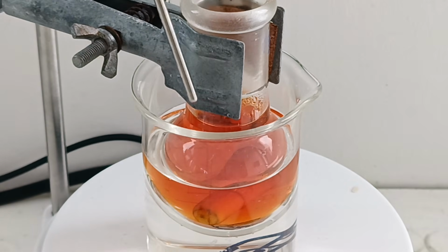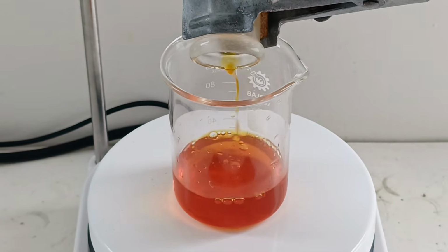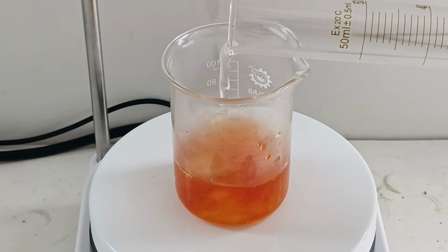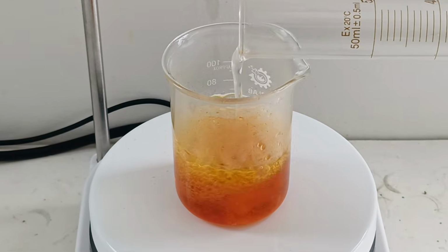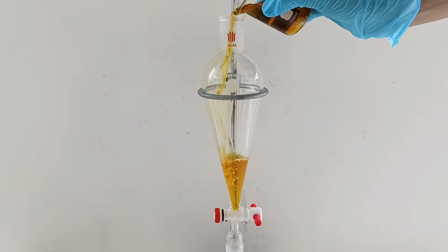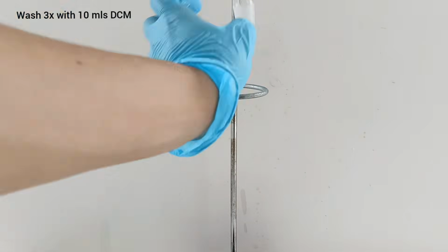Once no more nitrogen gas is observed being released, which took around 15 minutes, I decant the solution into a beaker. We now need to extract the resorcinol from the mixture. The first thing I do is add some dilute sodium bicarbonate solution to neutralize the remaining hydrochloric acid and form its salt. This also causes any unreacted aminophenol to fully convert to its free base form. I then move the solution to a separatory funnel and wash it 3 times with 10 ml of DCM.